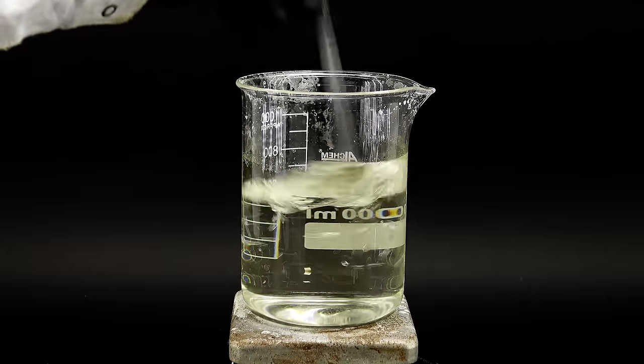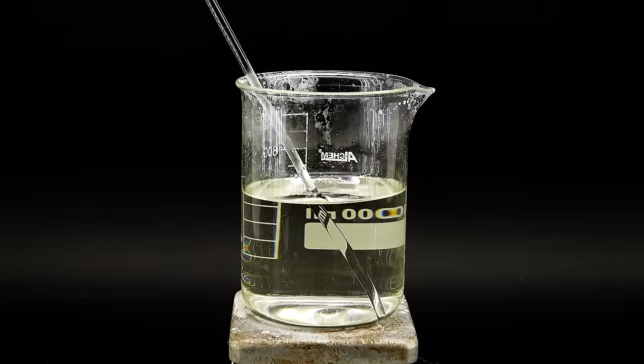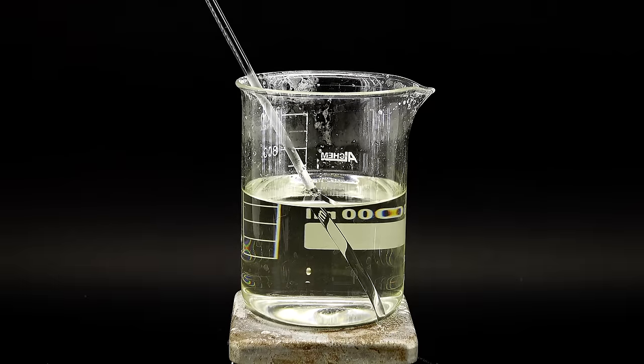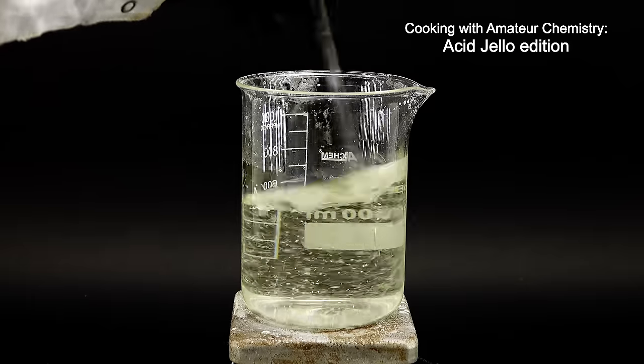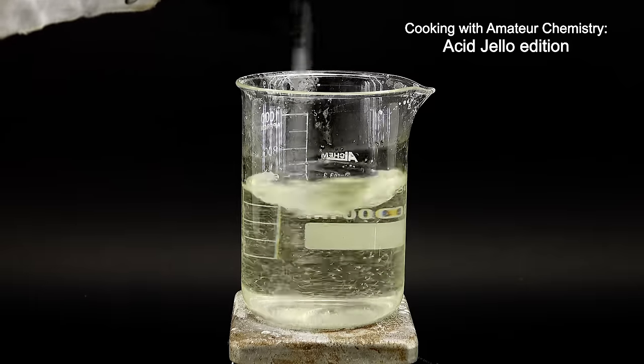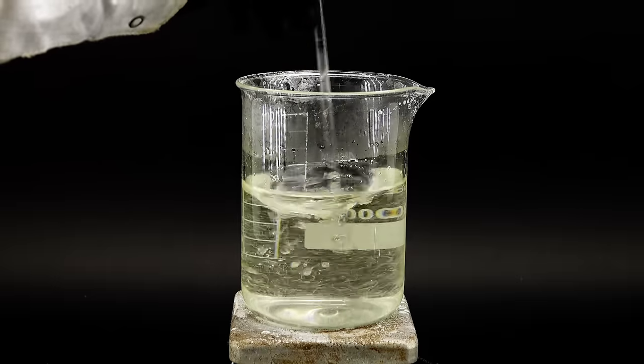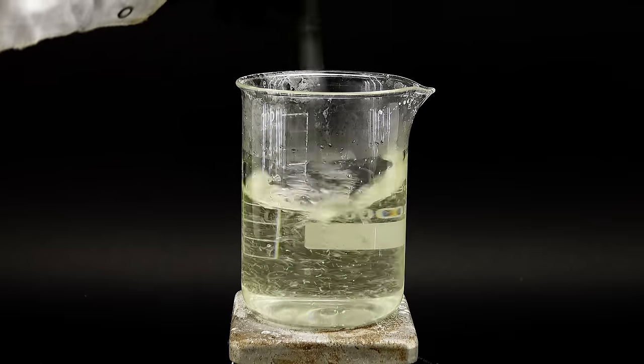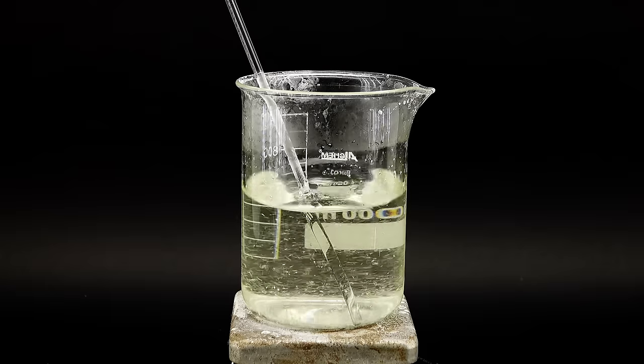This time, the solution was nearly colorless, and smelled weirdly of lemons. Before proceeding, I have to add a second ingredient into it, which is roughly half a gram of regular gelatin, which according to Songping Wu, should really help this reaction proceed. Anyway, I now have to make one final modification to this acidic jelly, and that is, adjusting its pH to 6, which should really increase the yield, again according to the almighty Songping Wu.